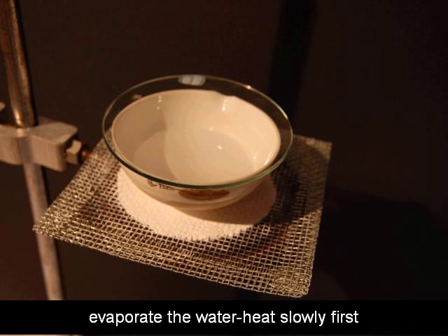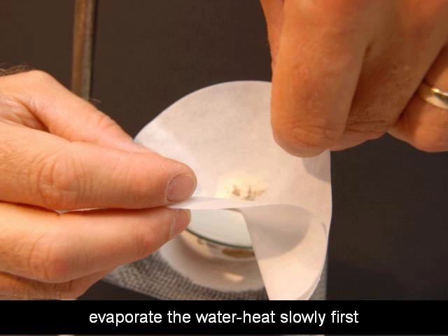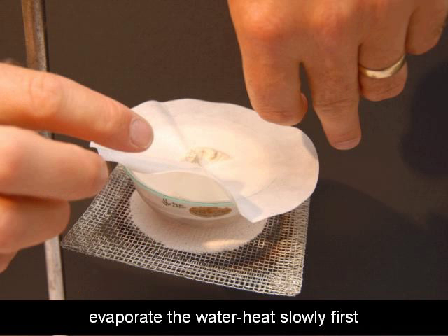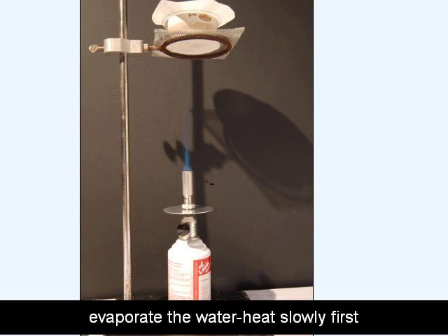So get your height adjusted, then you can turn the Bunsen burner off and set your evaporating dish and watch glass on top of the evaporating dish. Because the salt water is going to start boiling and it will splash. So you want to keep it from splashing out or you're going to lose salt and then you will get an error on your salt reading. Then take the filter paper out of the funnel and unfold it and you'll have the sand in the middle of that. Lay this on top of the evaporating dish. And here's a little bit different view with the evaporating dish, watch glass and then filter paper and sand on top of it. All raised up very high. The tip of the burner flame just barely touching the bottom of that wire gauze. Let that evaporating dish warm up slowly for about two minutes.